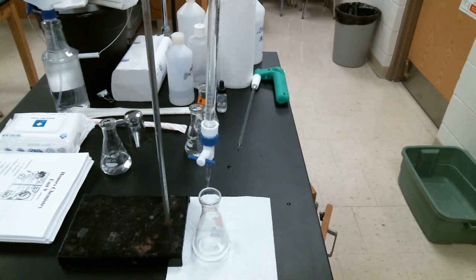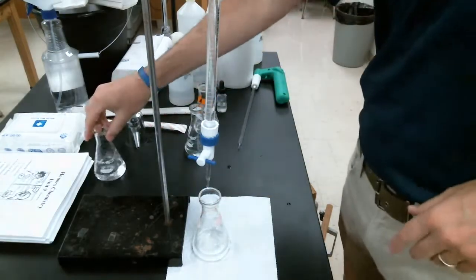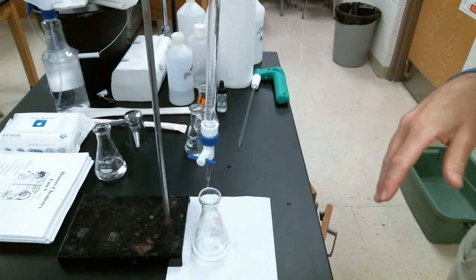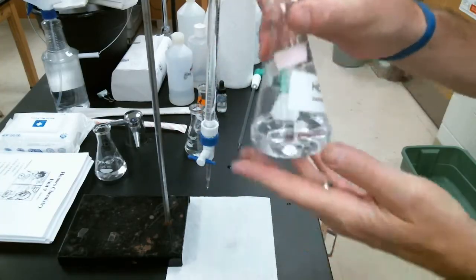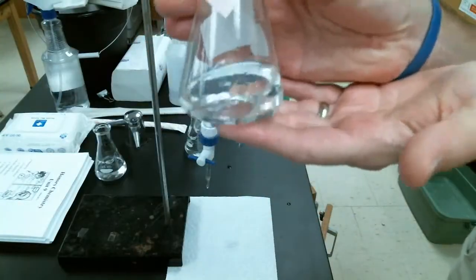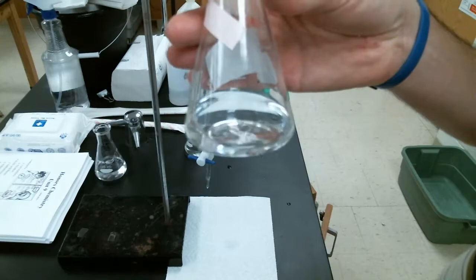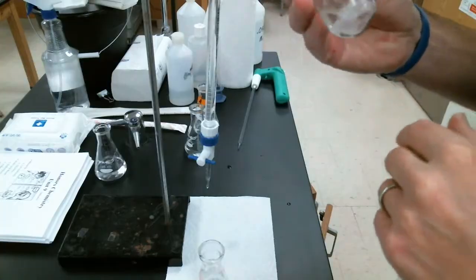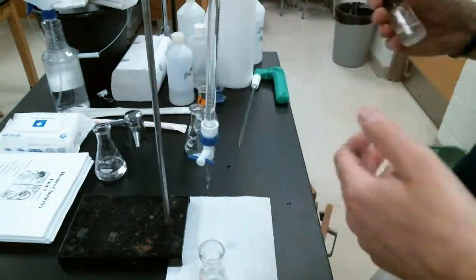In this setup, our burette is where we've put our titrant, which is sodium hydroxide, NaOH. And in our flask is our analyte, the solution that we are trying to determine the concentration for, which in this case is sulfuric acid, H2SO4. I've already prepared my flask with my unknown, so ignore that label there. I've added 15 milliliters of acid, 20 milliliters of distilled water, and a couple drops of phenolphthalein, our indicator.